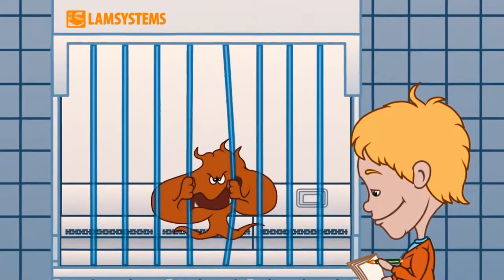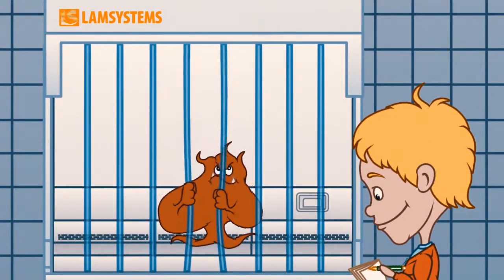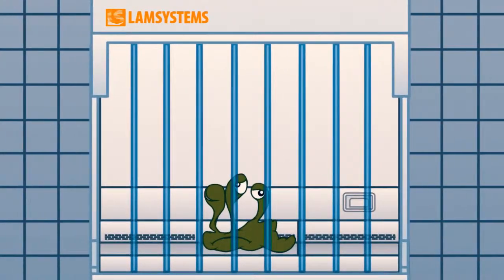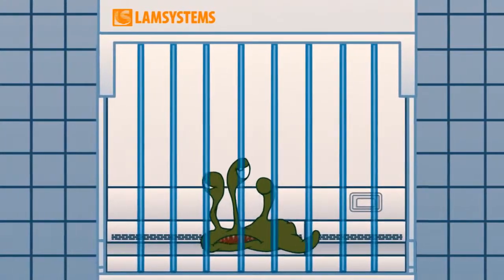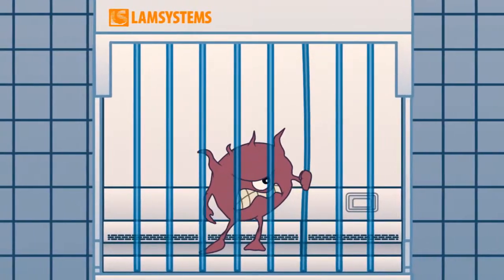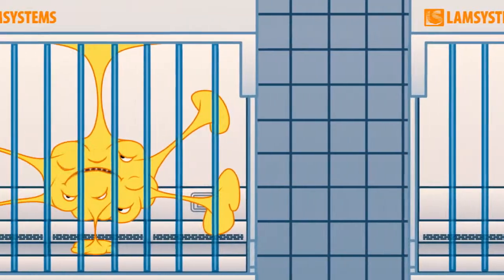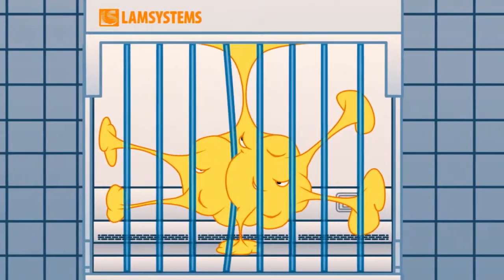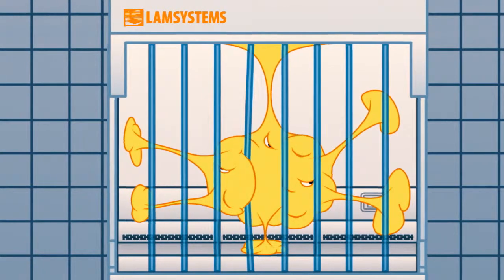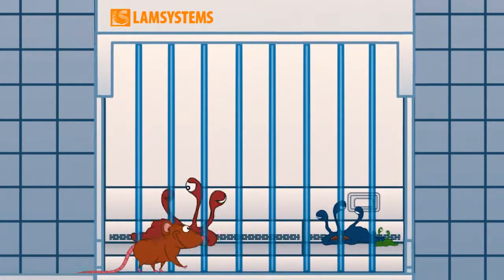The results of the potassium iodide test have dramatically demonstrated that the LAM Systems Class II microbiological safety cabinet truly provides an extremely high level of protection to the operator and the surrounding environment from microbiological contamination.